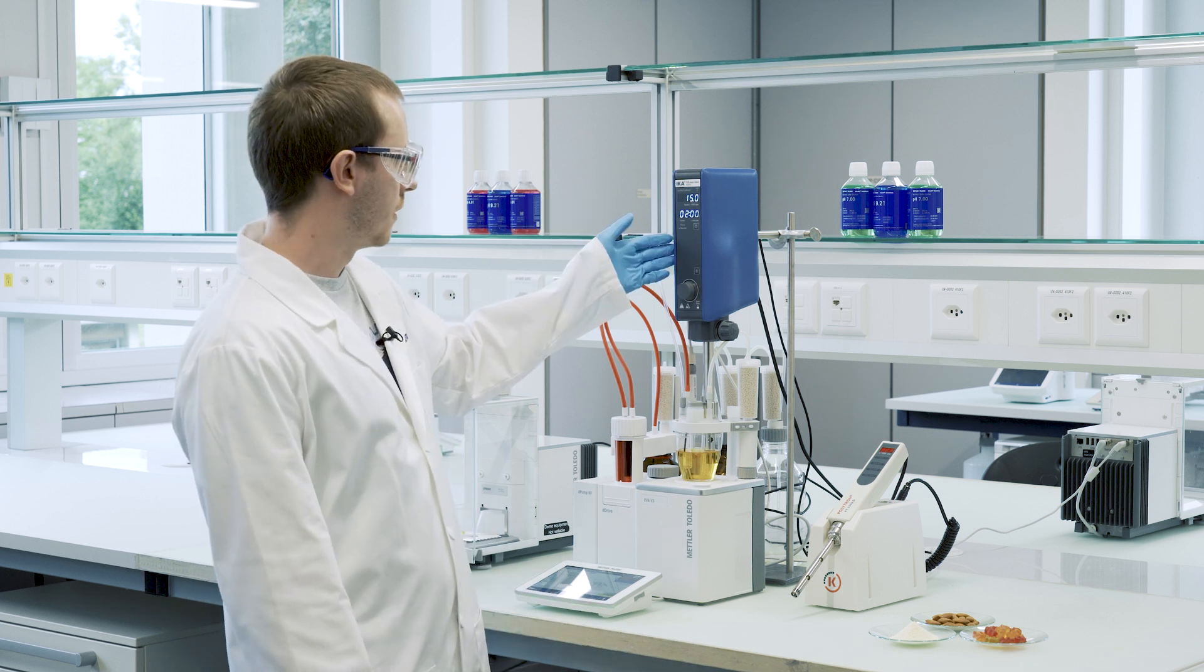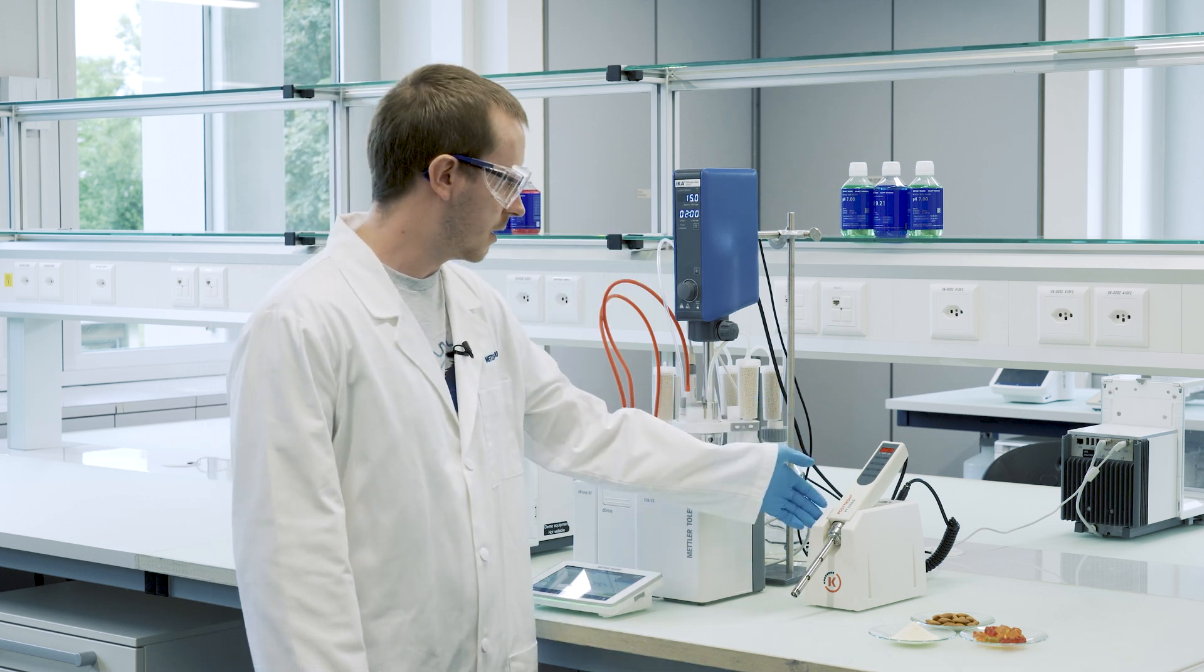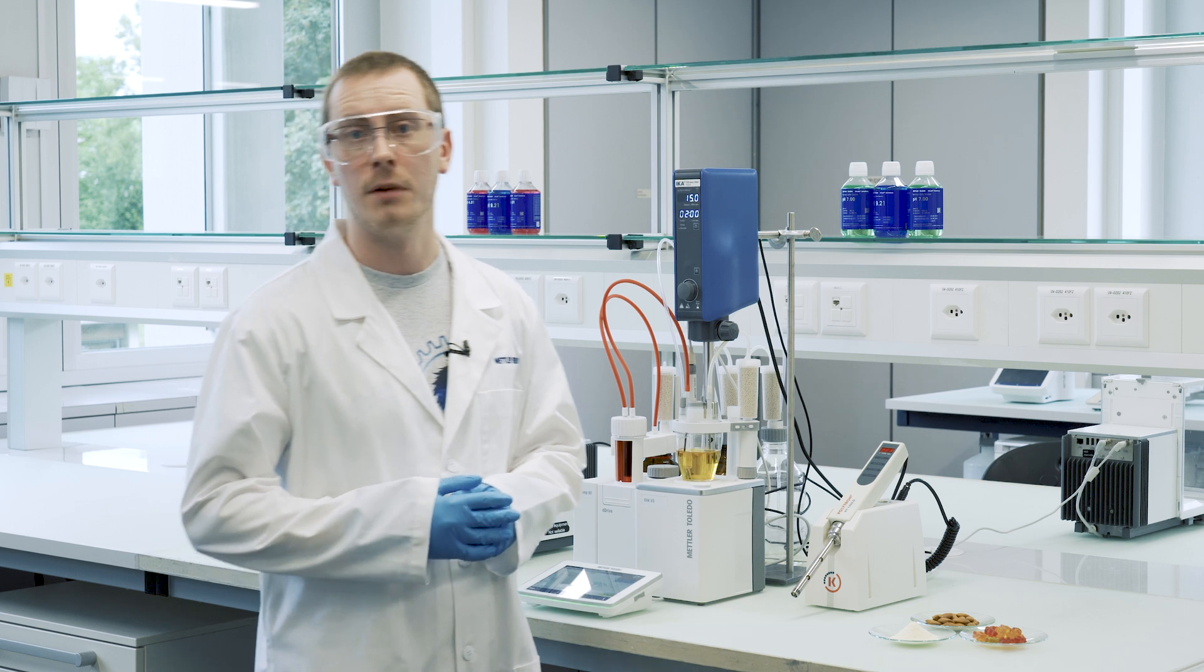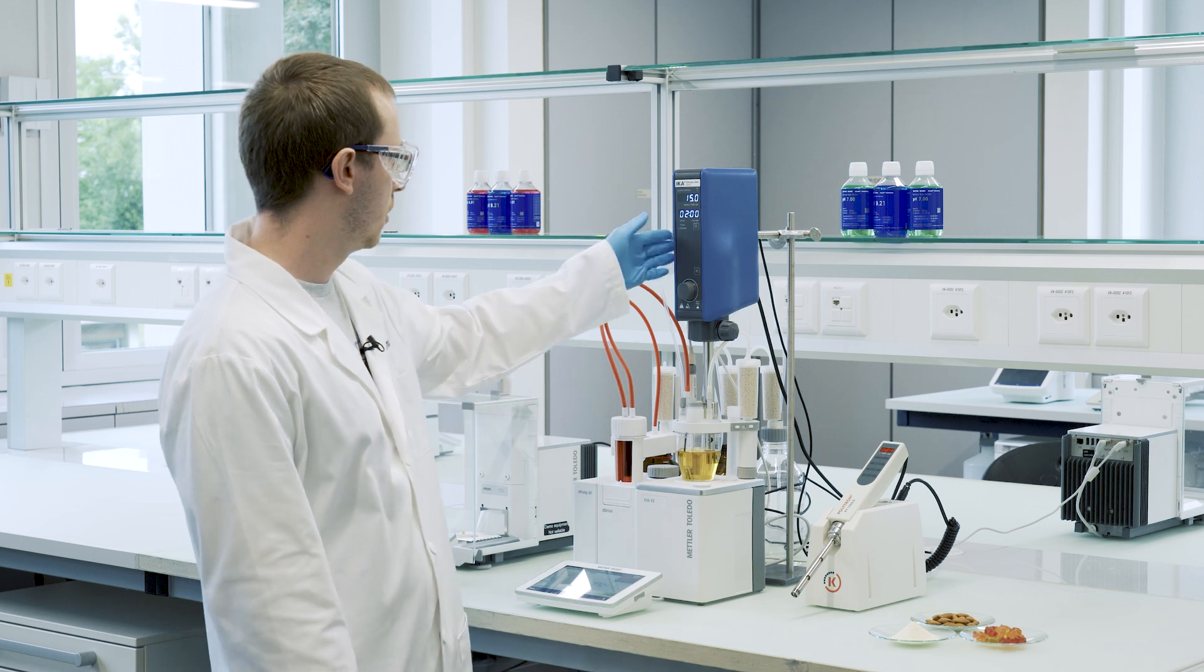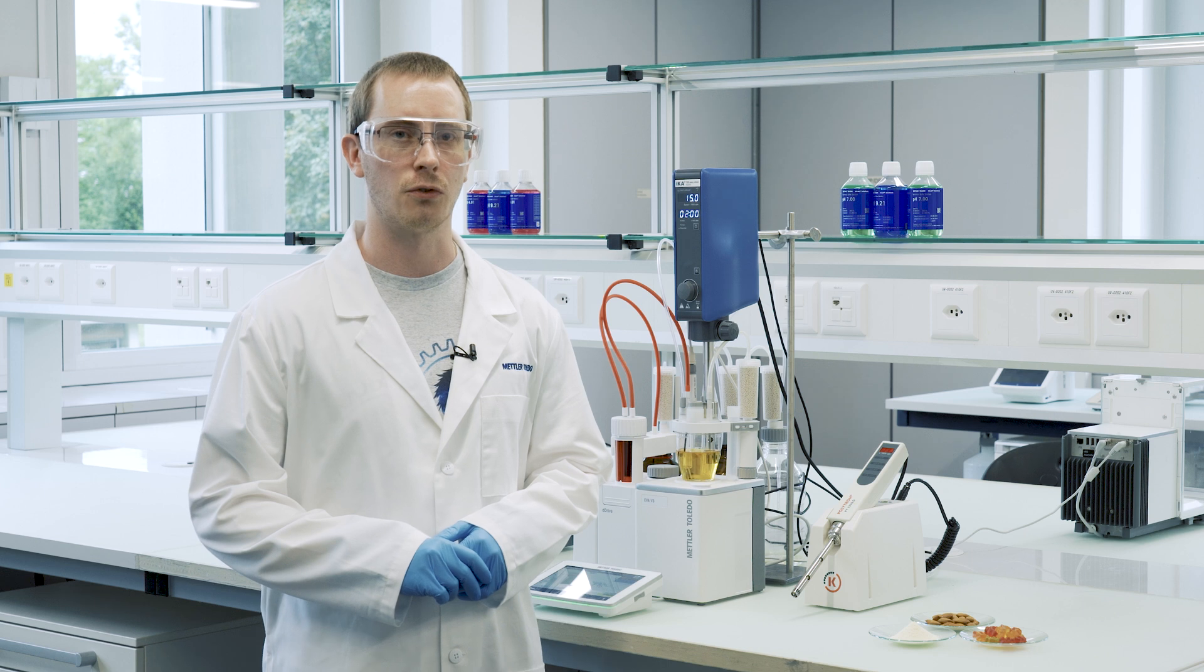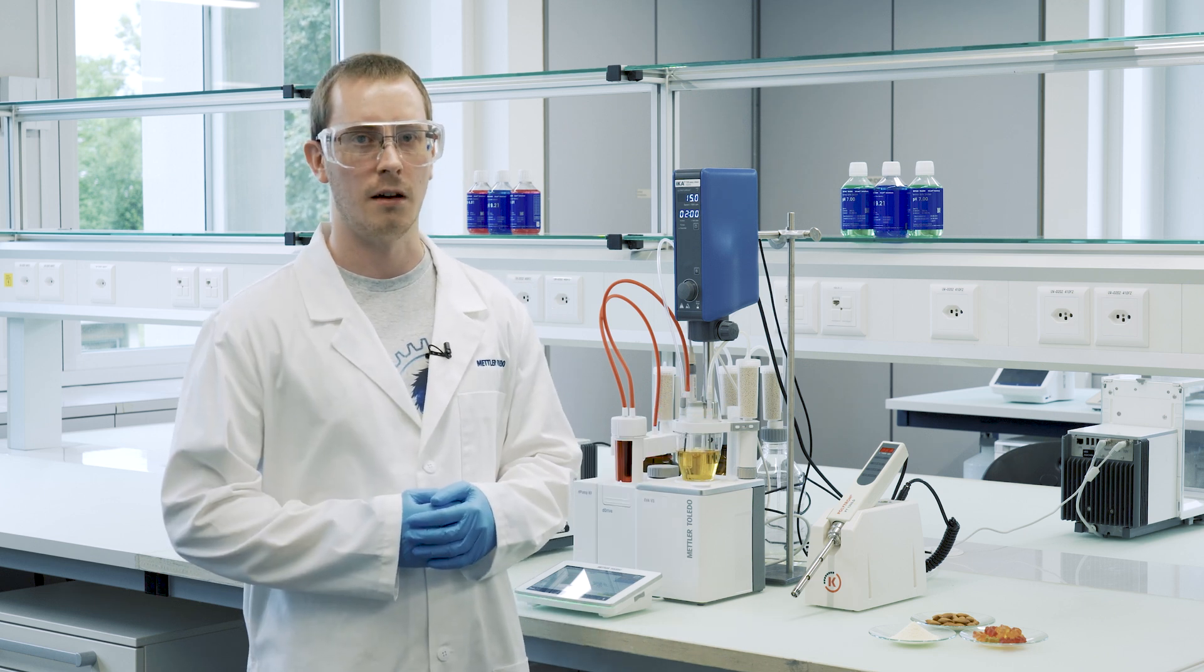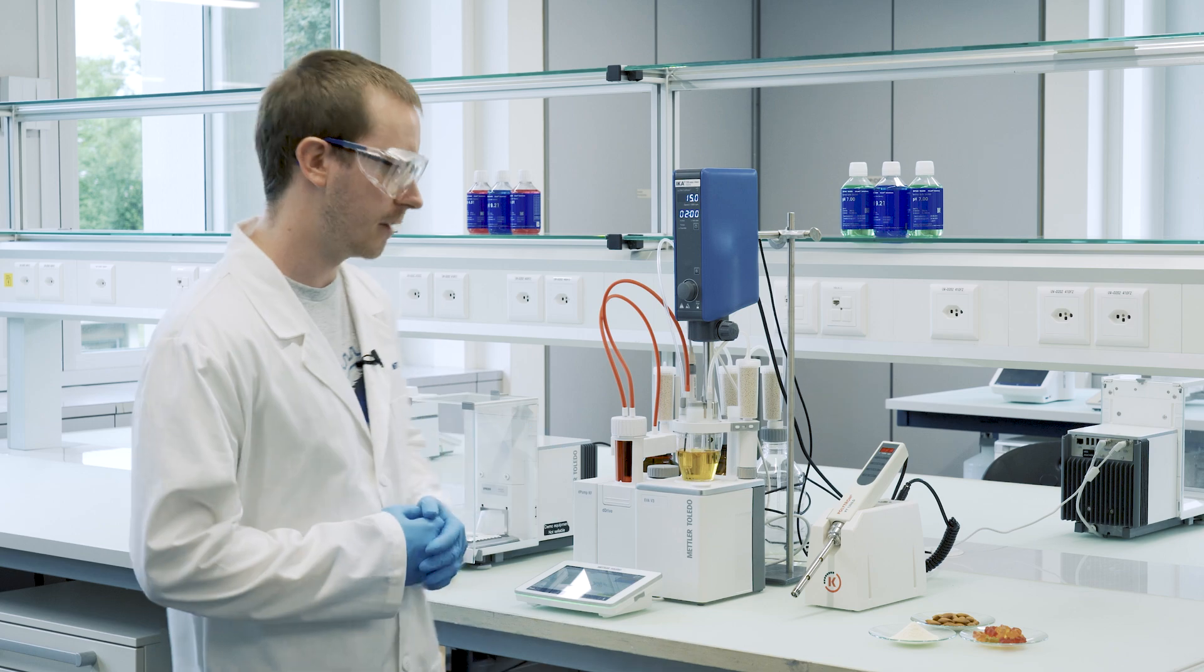We support two brands of homogenizers. One is the IKA, the other one is the Kinematica, and for our applications these deliver equivalent results. Today we have set up the whole system with the IKA homogenizer and both of them can be controlled directly from the EVA, and I will show you quickly how this is done.